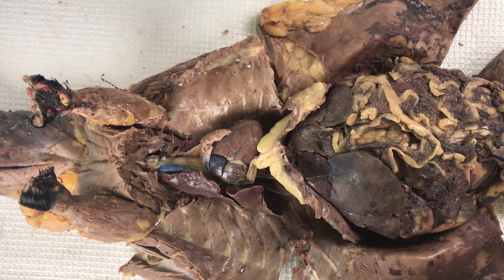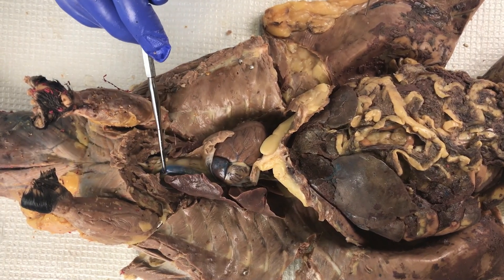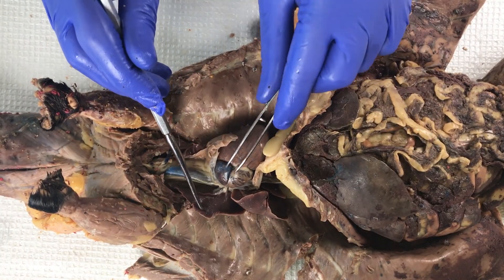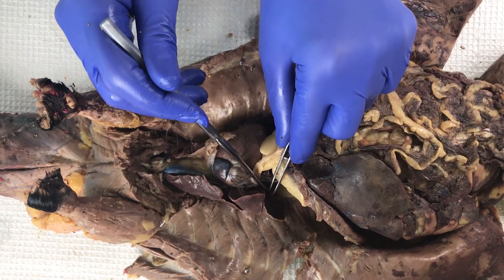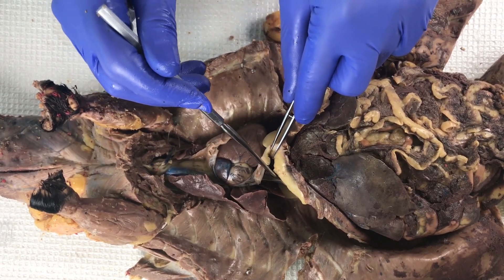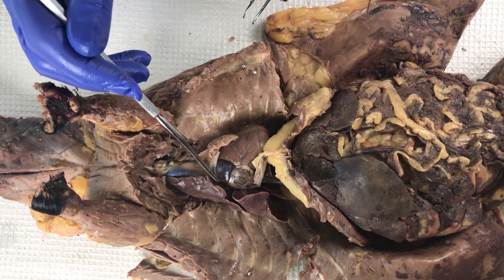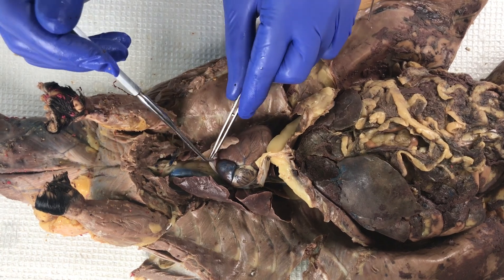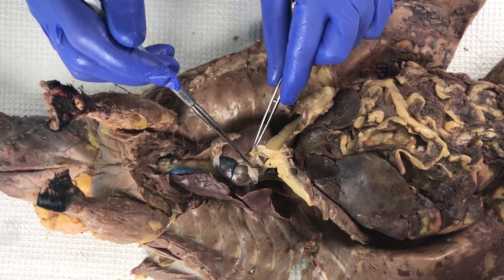From another view — top down — you can also see the superior vena cava once more. Moving those lobes of the lungs out of the way, you can more clearly see the inferior vena cava right here. From this view, you can also see both atria and both ventricles very clearly. The pericardium has been opened to reveal these structures of the heart.